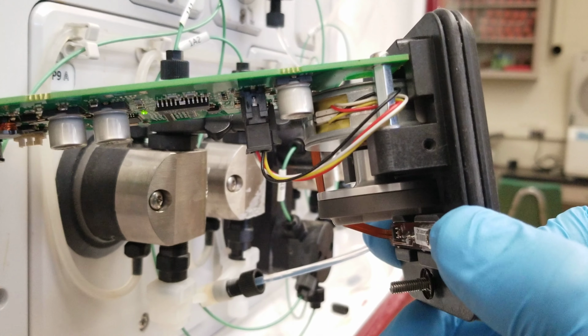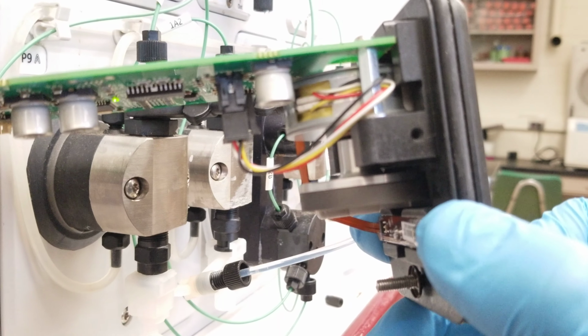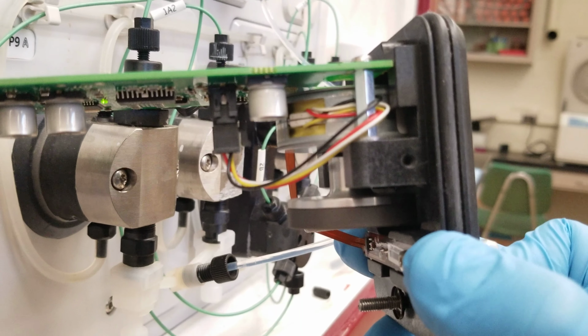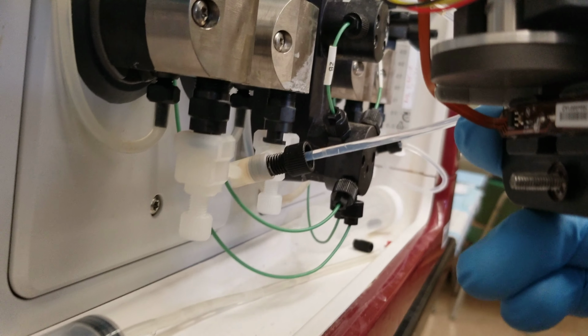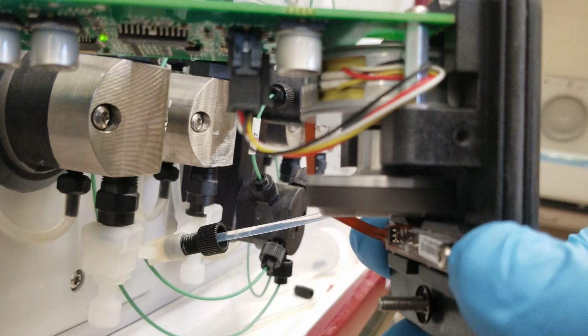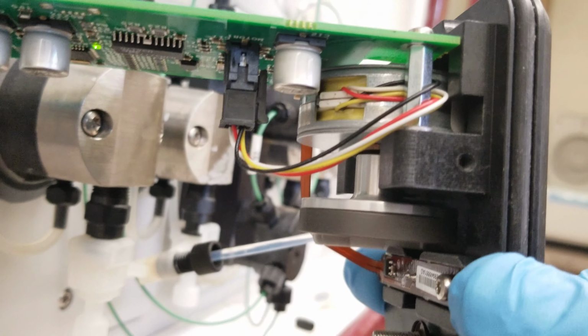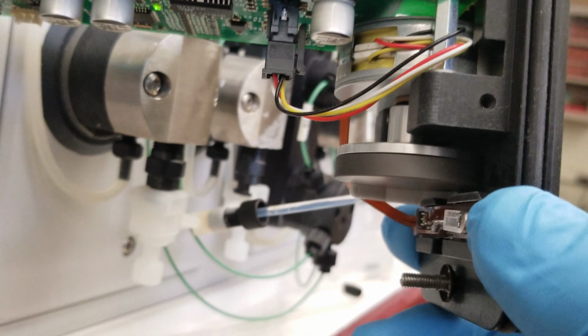Okay. I think I found it. Probably you focus on that shiny thing over there inside. And there's this black patch. I can see it, because it's moving. Oh, I see. You see that black thing? It's like a blur. So why is there a black thing in there? You know what I'm talking about? Yeah. And I can see through my camera that it's protruding. So maybe we should stop.